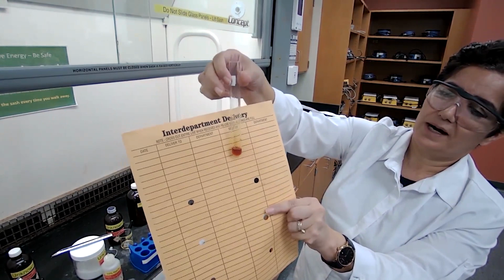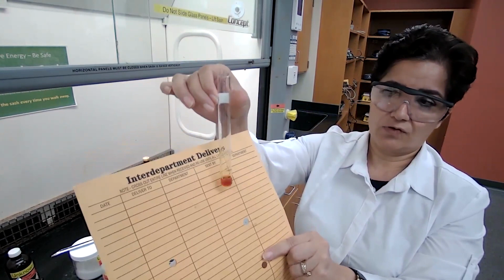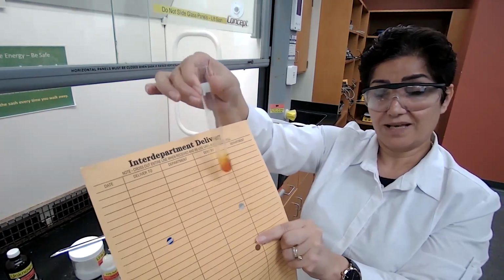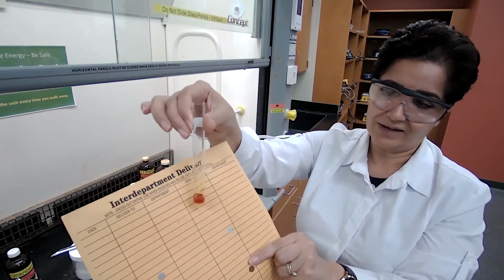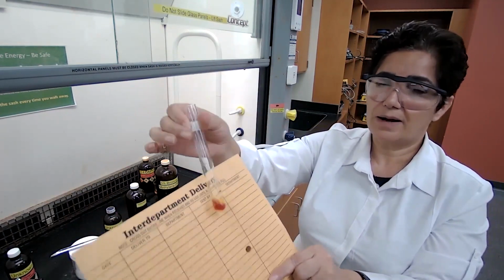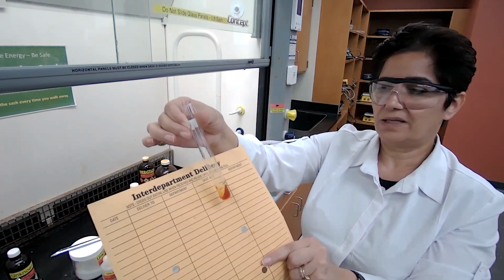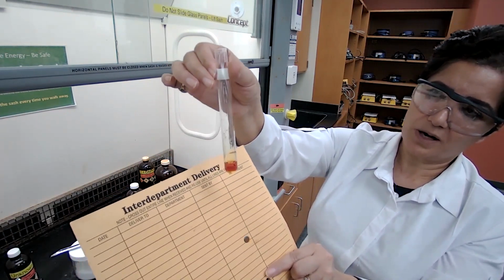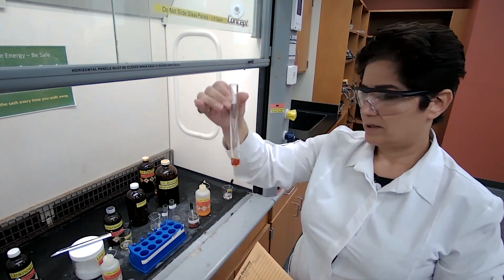So remember the 2,4-dinitrophenylhydrazine test that I did with unknown 4, and a precipitate did not form. This is the reason, because right now the ceric ammonium nitrate shows that we have an alcohol. So there's really no need for me to do the heating up or wait long, even though I waited for 10 minutes and no precipitate formed. So we know that unknown 4 gives a positive test with ceric ammonium nitrate.